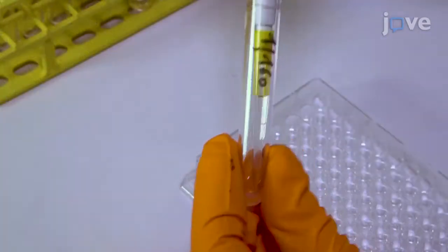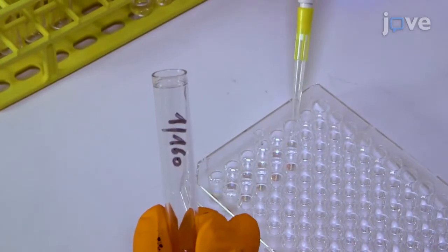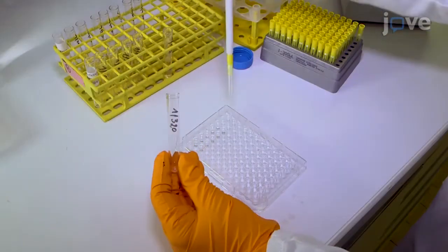It is promoted by the manufacturers and national control laboratories. It is critical to distribute precise volumes in duplicate for each dilution and to well dry the plate on absorbent paper after washes to avoid background.